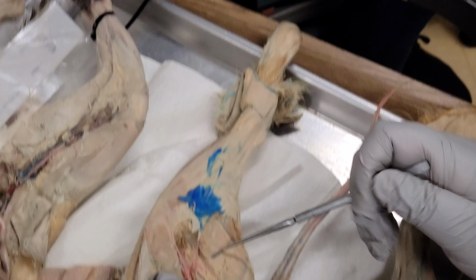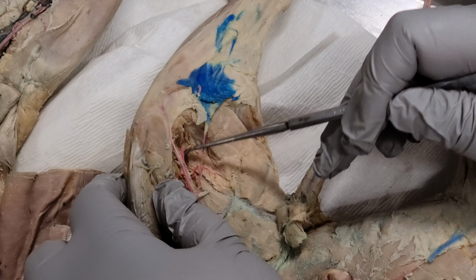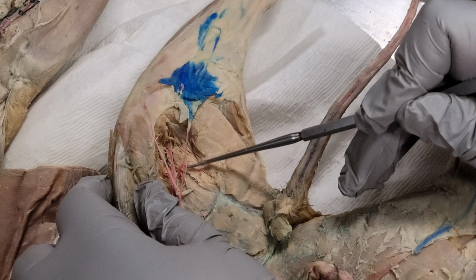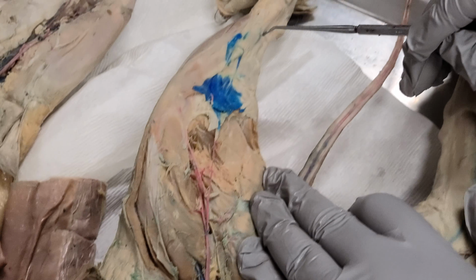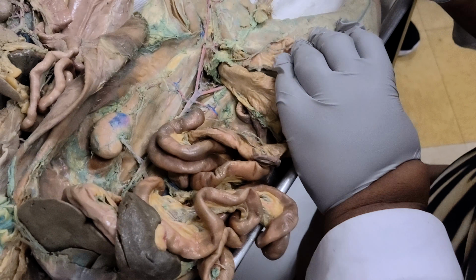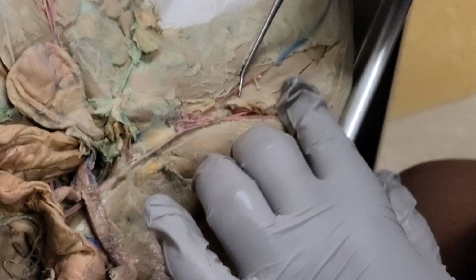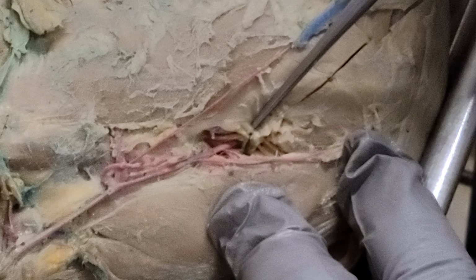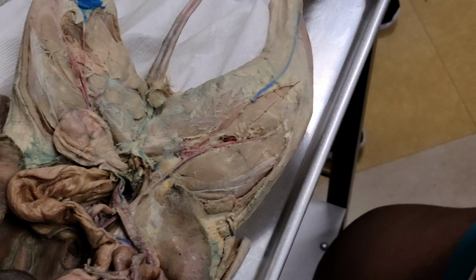Going down the thigh. And then when we get to the knee, it splits into three. So you have your superior articular, popliteal going towards the back of the knee, and then saphenous. This will go all the way down. If it was dissected, you would see that it leads all the way down the leg. So it's kind of like the brachial of an arm. Let's see if we can see it on this side. So we have femoral, superior, popliteal, saphenous. Okay. Yeah, that's it.